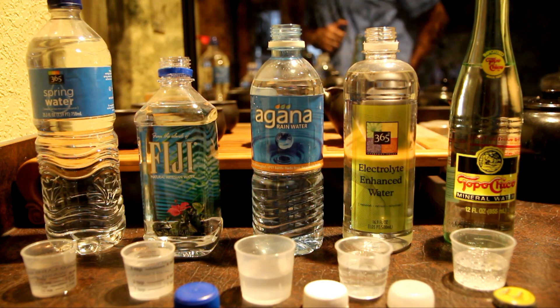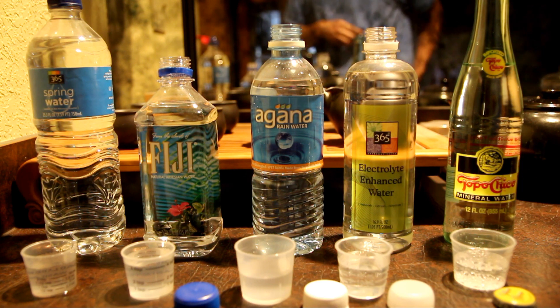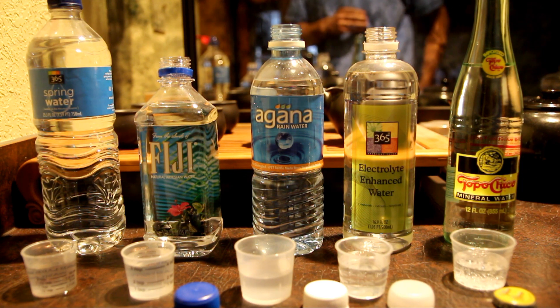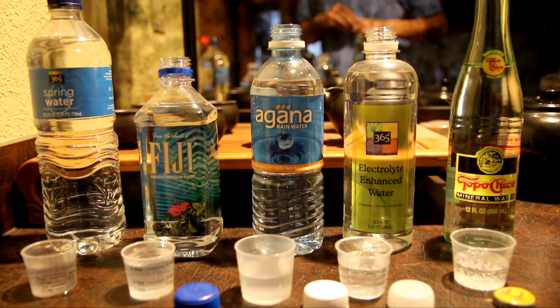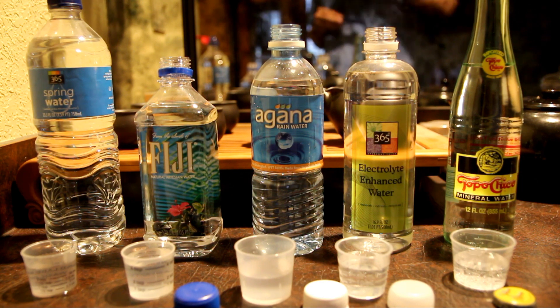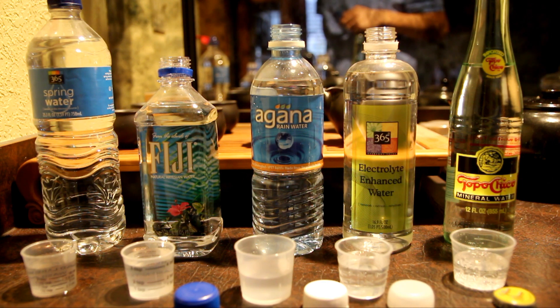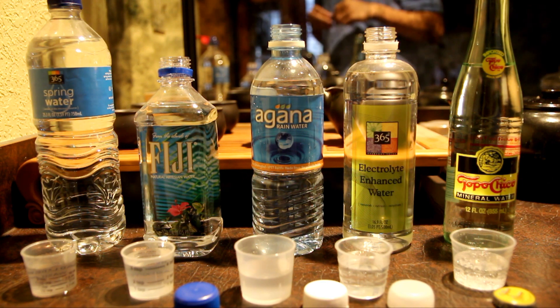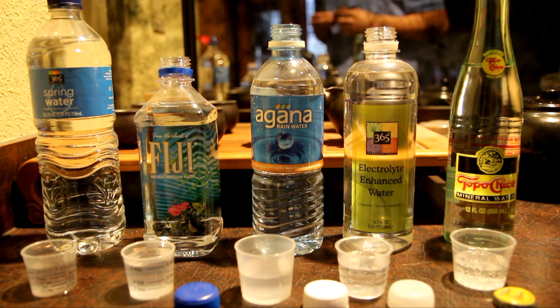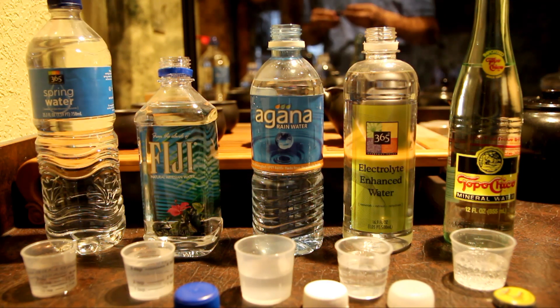I'm always curious what's their TDS — total dissolved solids. As we know, reverse osmosis water only has a low TDS, maybe 5 to 10 parts per million. A lot of people call it dead water because there's no minerals, there's nothing in it — it's dead water.